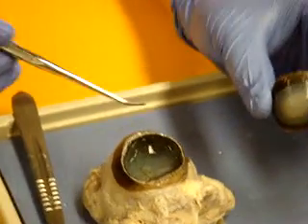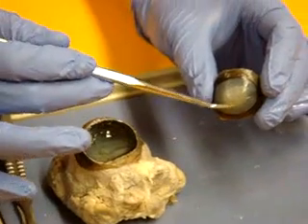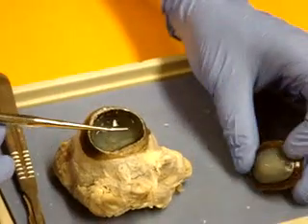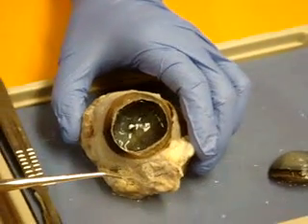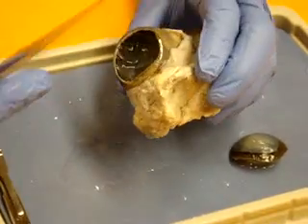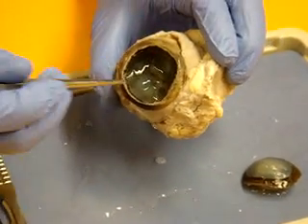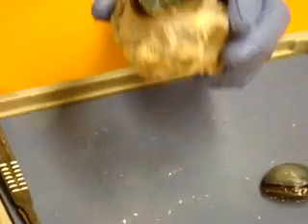The anterior cavity consists of the cornea to the lens, and anything behind the lens is the posterior cavity. So now we are looking into the posterior cavity, and it is filled with jelly-like stuff, which is vitreous humor.